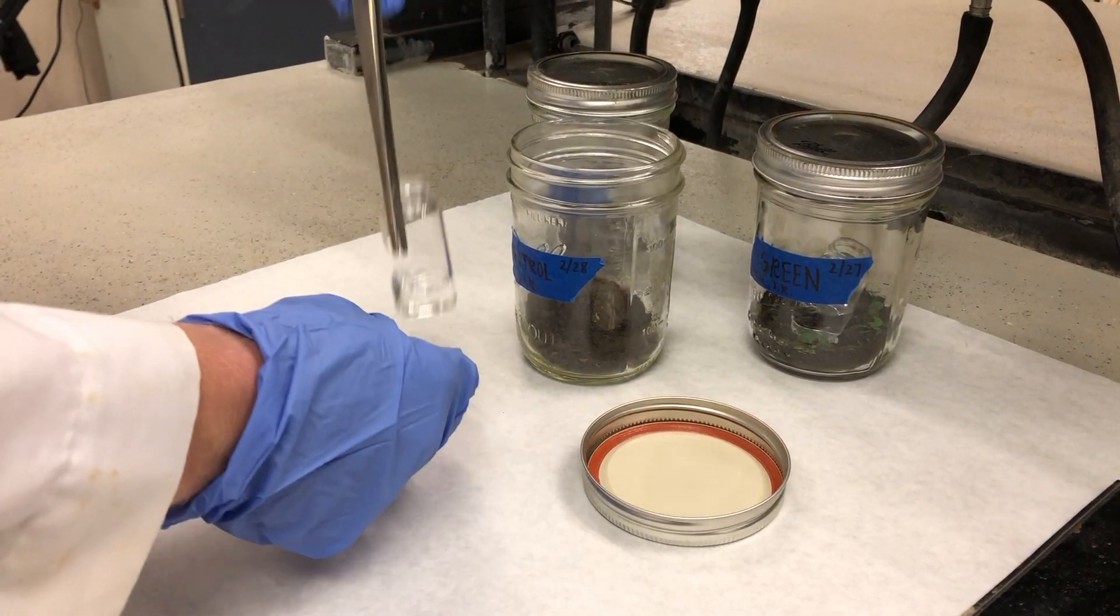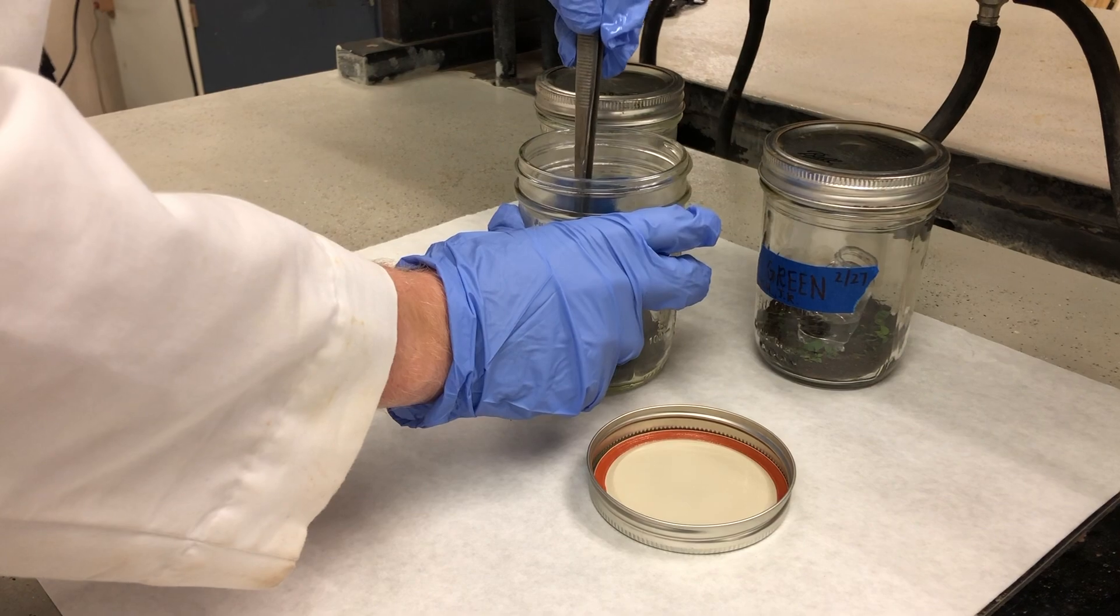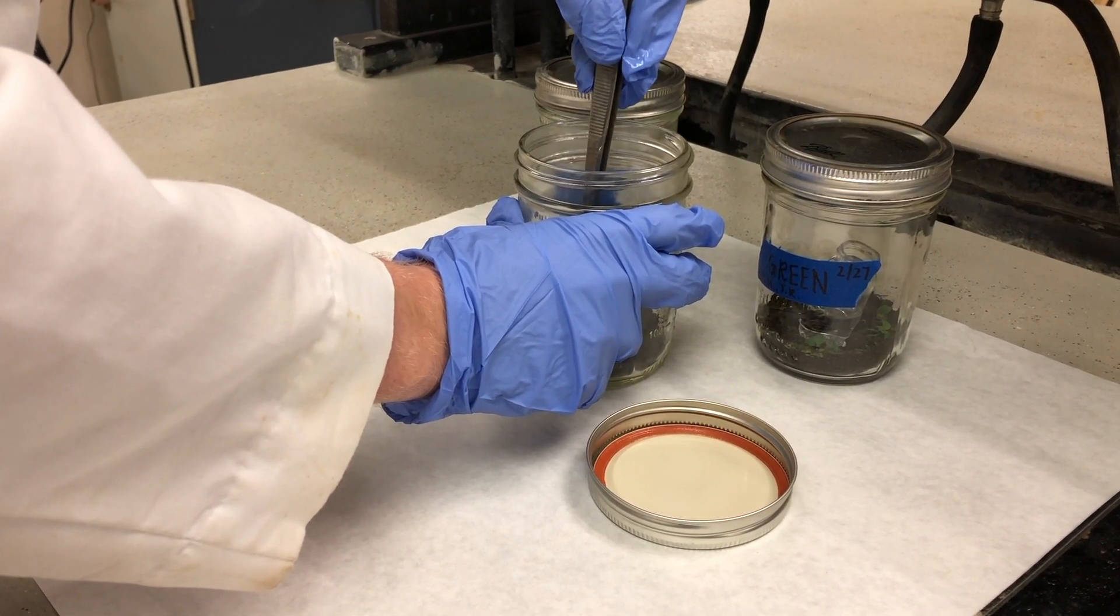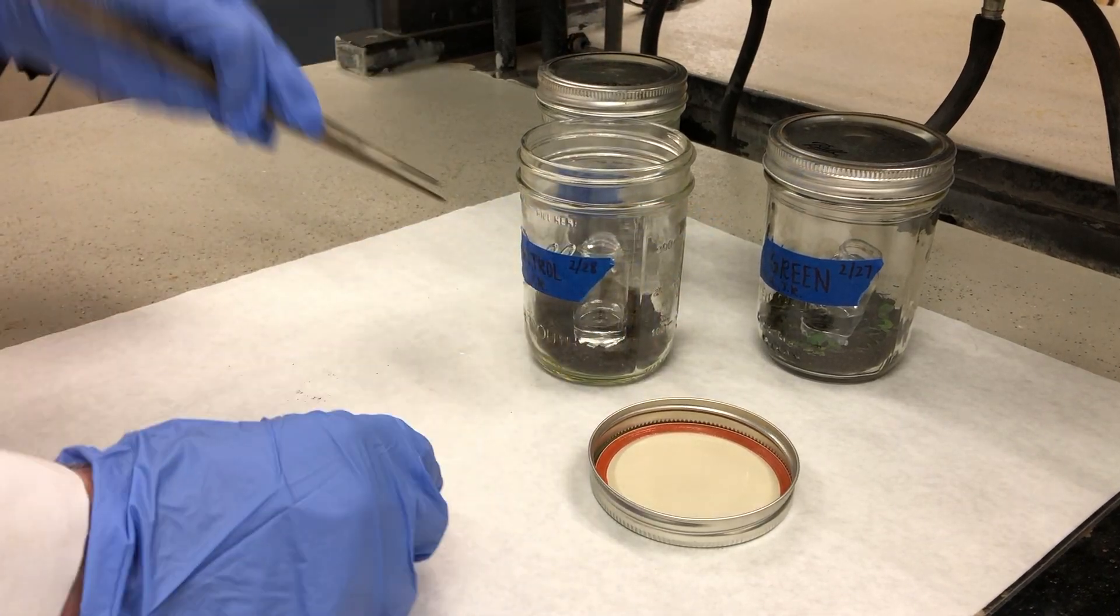The vials may be refilled with sodium hydroxide, placed back into the incubation jars, and this process repeated at a later date to track changes in microbial respiration over time.